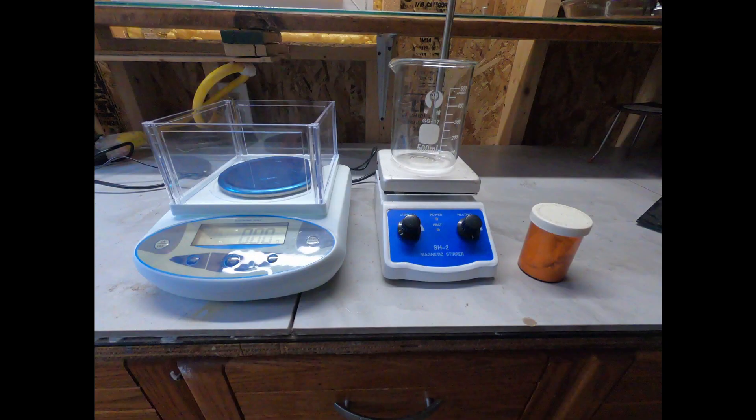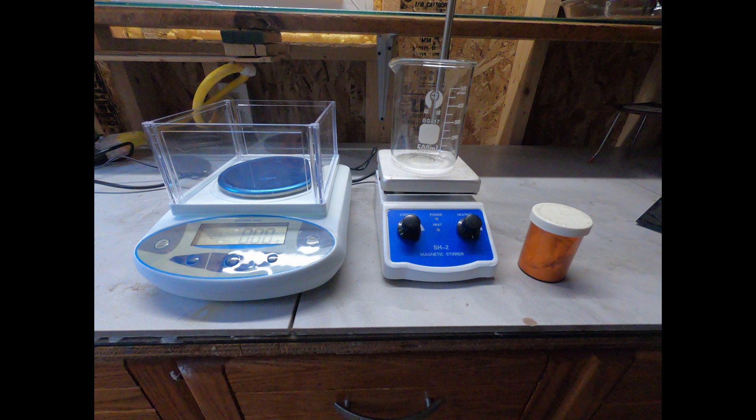For this process I'll be using sodium carbonate, some beakers, a hot plate, and a balance. It should be noted that sodium carbonate is an irritant, so it's important to wear proper safety equipment such as goggles, gloves, and a lab coat.